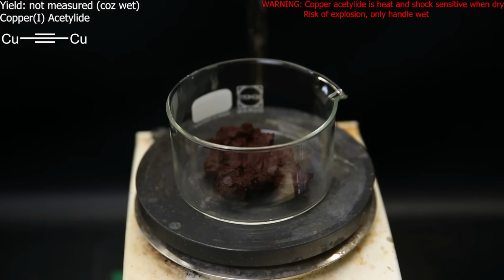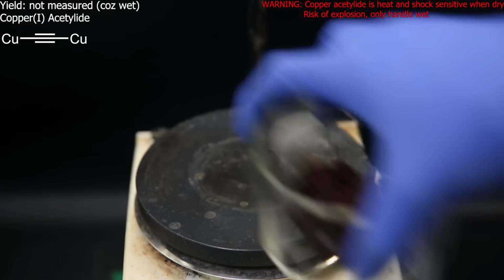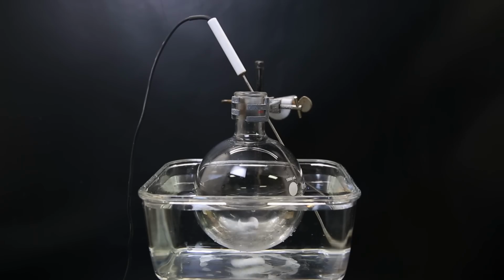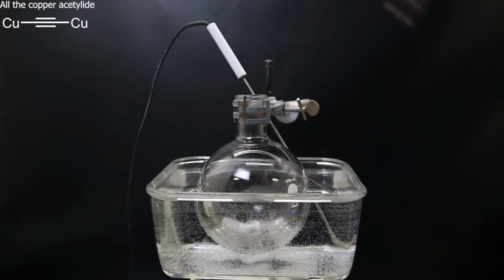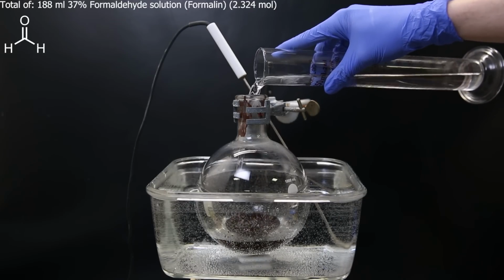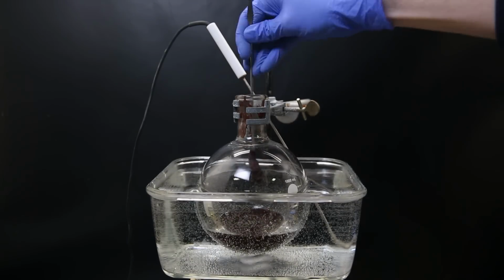Now that the catalyst has been prepared, I can set up the reaction. So I set up a large flask with a stir bar and put it in a water bath and start heating it to 60 C. I then add in all of the copper acetylide I just made. In between adding the catalyst paste, I start adding a total of 188 ml of a 37% formaldehyde solution.